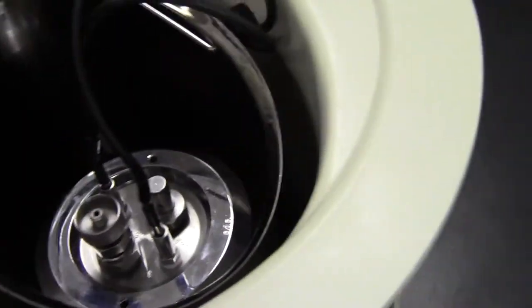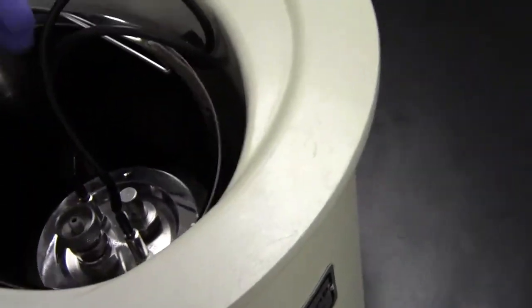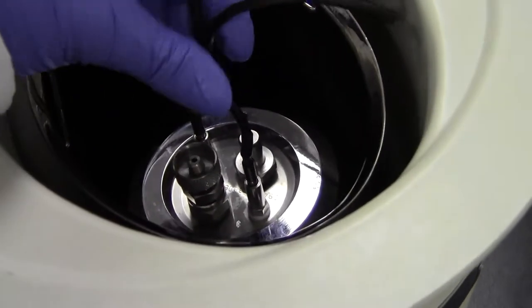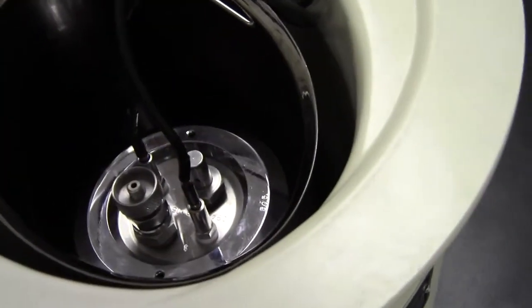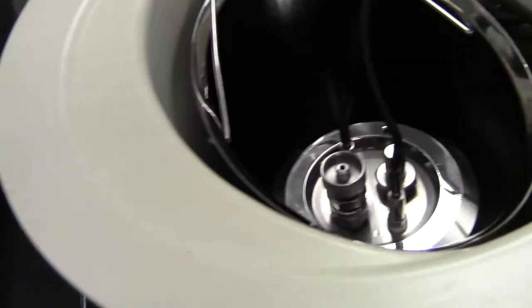So mine's not full of water right now, and I would be working below the water level if there was water in it. So make sure before you actually descend it all the way down to the bottom of the bucket, you actually put your leads in place. Then we're ready to put the lid on.